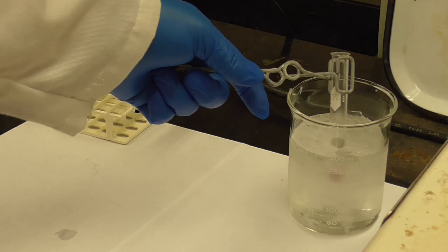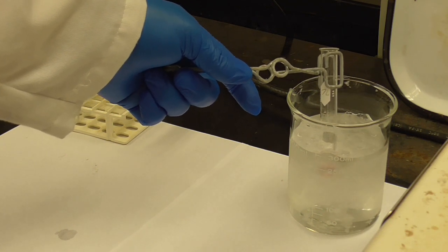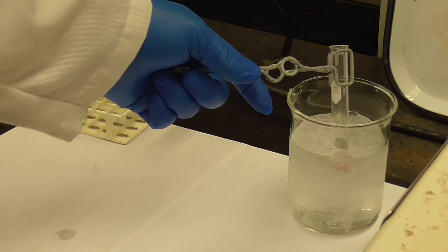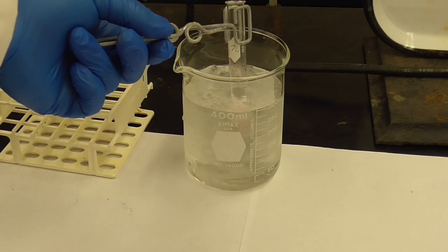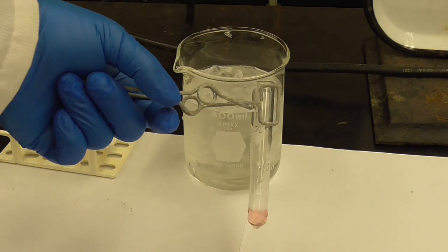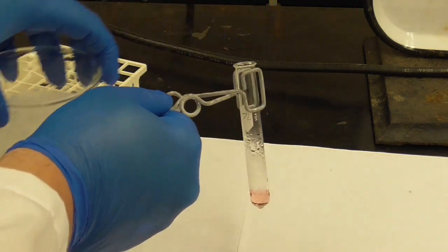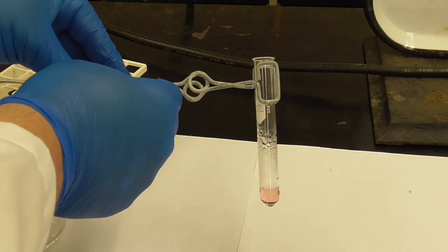Now this one you're not going to be able to see because of the ice, but we'll leave it in there. We'll let it chill down, and then we'll pull it out, and should be able to see it on the white background. So we'll give it a second here. Okay, so it's been in the ice for 30 seconds to a minute. Let's see if we can see what the color looks like. Okay, so you can see that over the white background there. Move the beaker of ice out of the way. Okay, so that's the change.